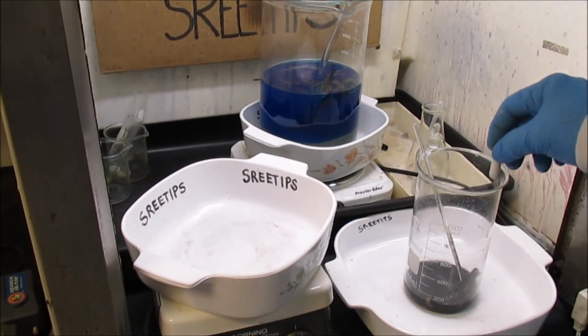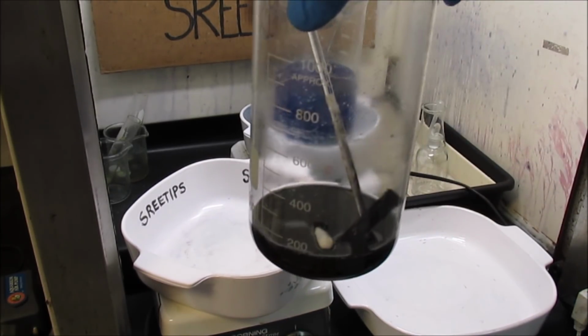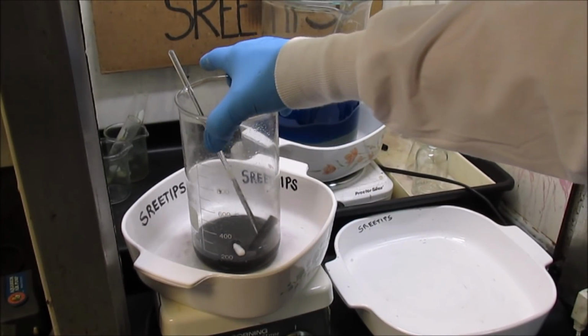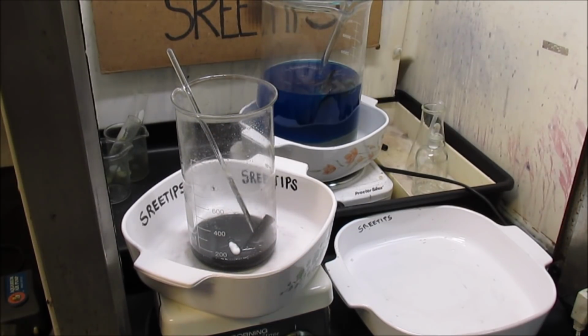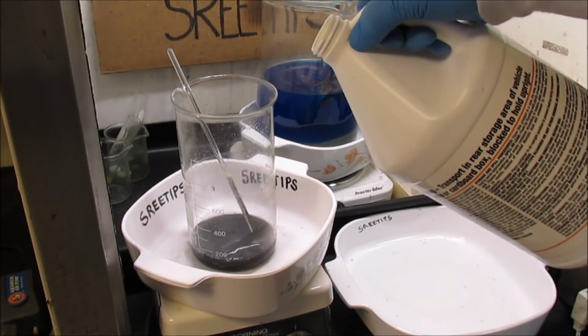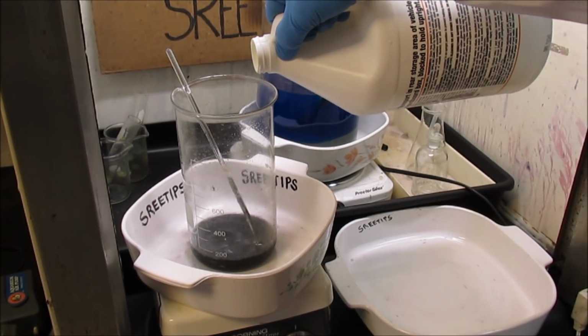I'm going to drop a stir bar down in the beaker. You can see there's a piece of undissolved zinc there. Put this up on the stir plate here. Turn the stir bar on. Now I'm going to add some hydrochloric acid here to try to dissolve out any remaining zinc that's in there.